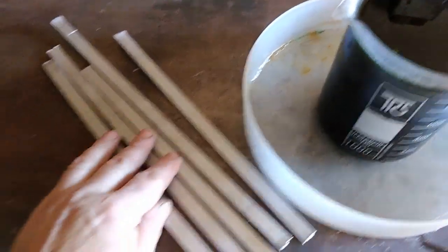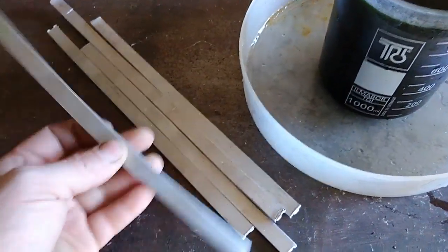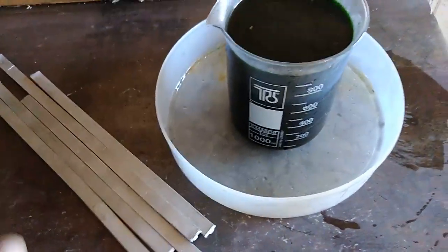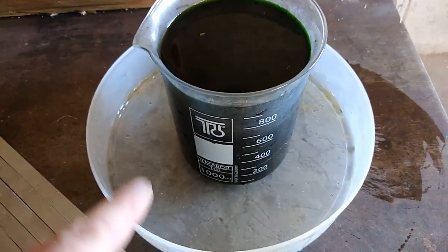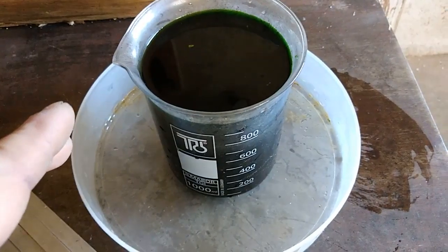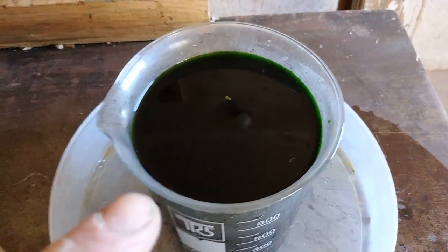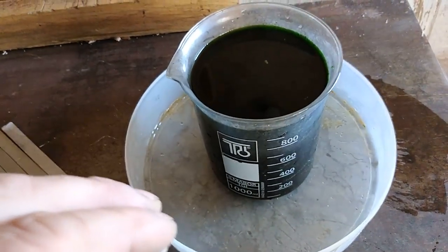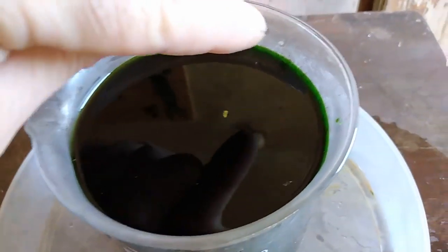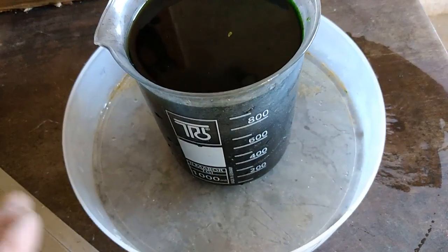Here I got a couple of nice clean aluminum bars and this is pure aluminum — definitely a high grade, very pure aluminum. Here in this beaker I have a one liter, 1000 milliliter saturated AP solution. This is the solution from my last video about silver recovery from silver plated pins and it's very, very saturated — you can see it has a very nice color.